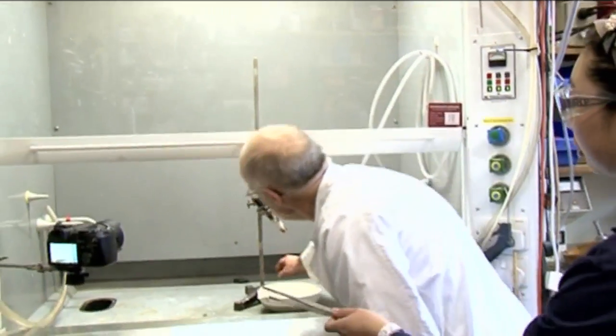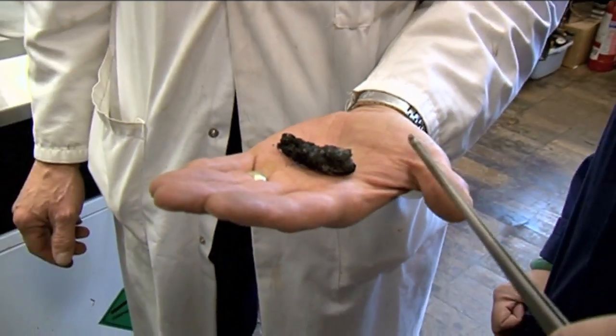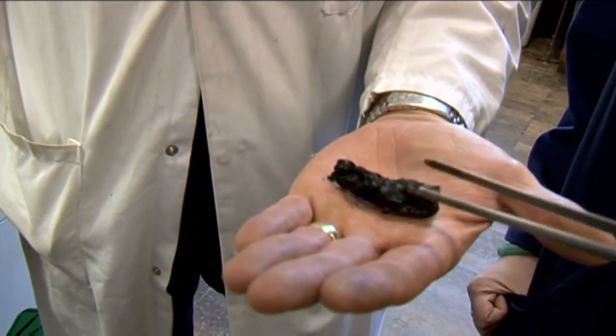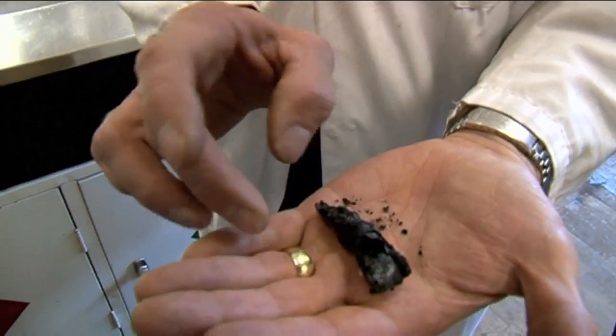Hang on. Do you want to... Is that part of the reaction? It's the jelly baby. What's left of it. Oh gosh. So if I just tilt it around, you can see it's hollow. It's very odd.